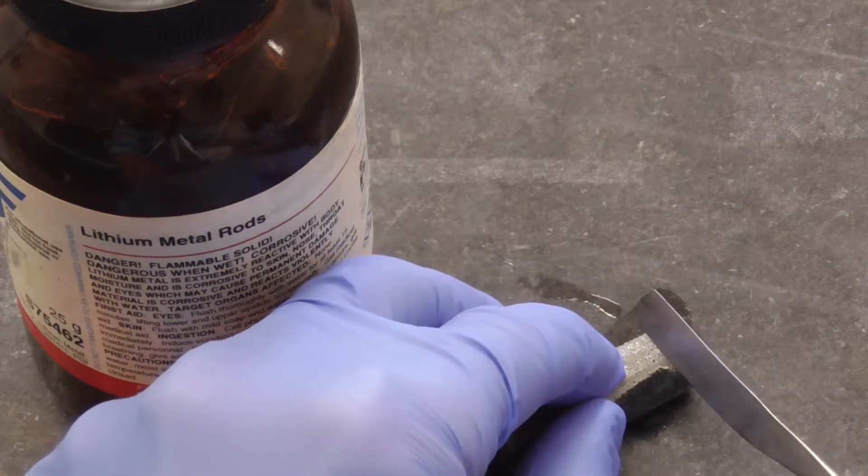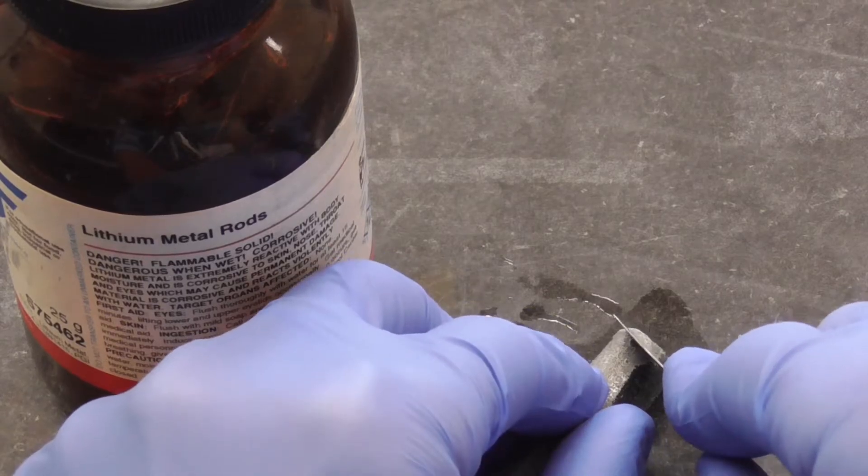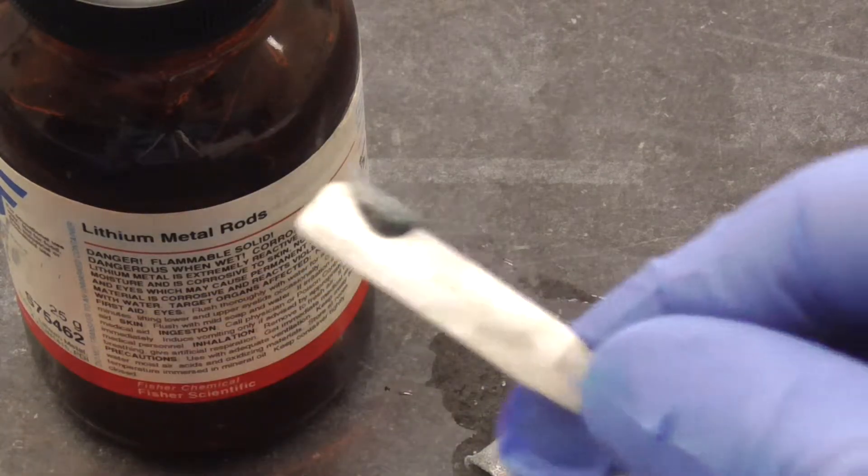Watch how easy it is to cut a piece of lithium metal. I can use this small utensil to shave some pieces of metal off of the rod.